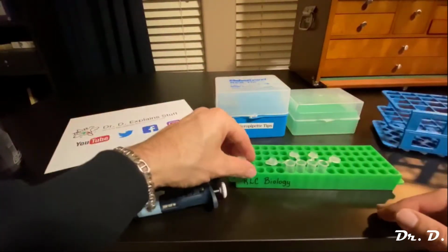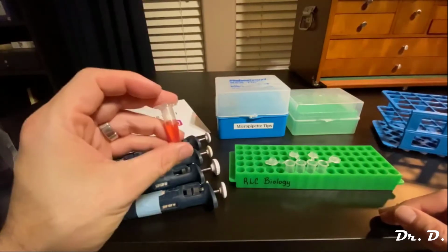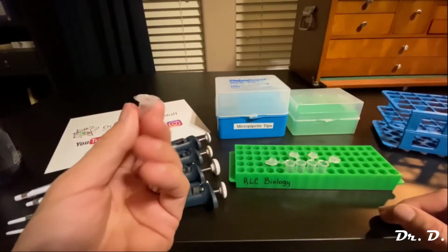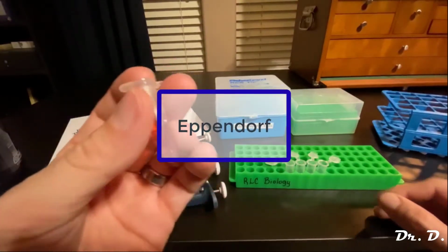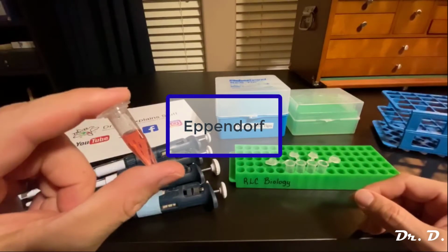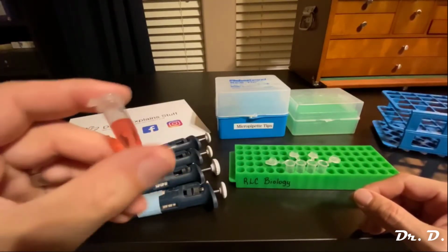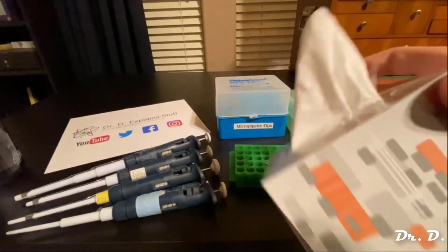In the biochemistry lab, like I said, a lot of times you're dealing with microliters. So you're going to use these microcentrifuge tubes. By the way, a lot of times they call these Eppendorf tubes. You know why? Because Eppendorf is the company that produces them. And just like if I say, hey, pass me some tissues, people will call this a Kleenex.